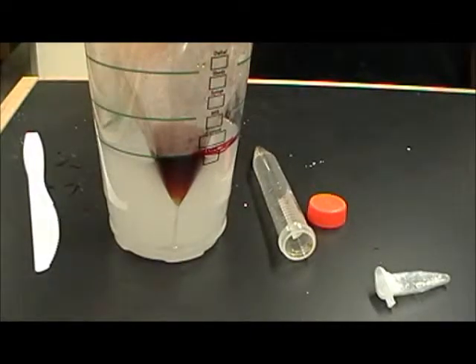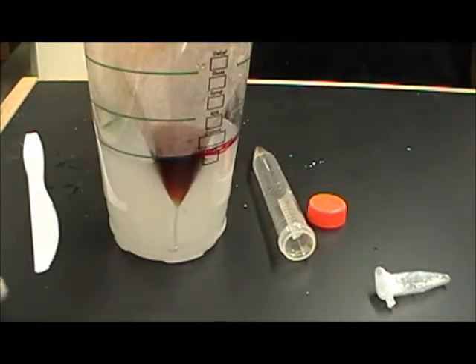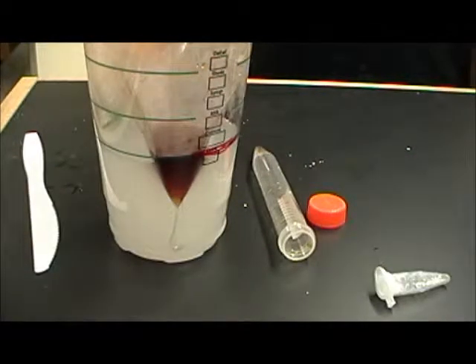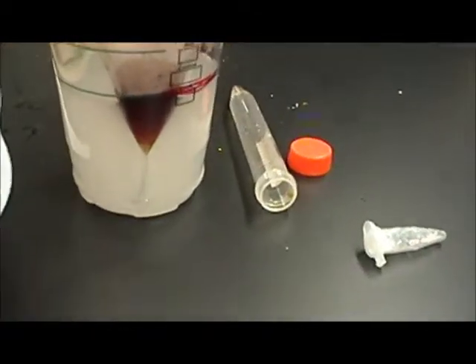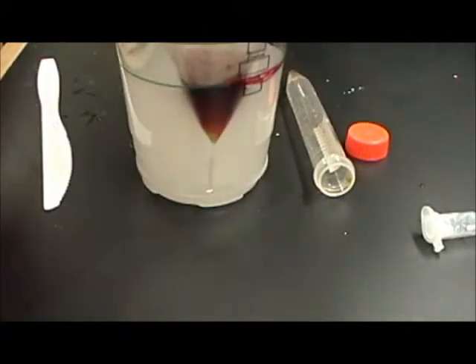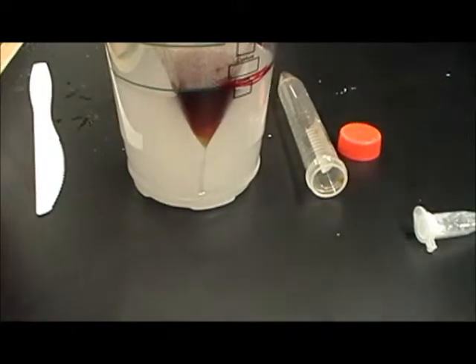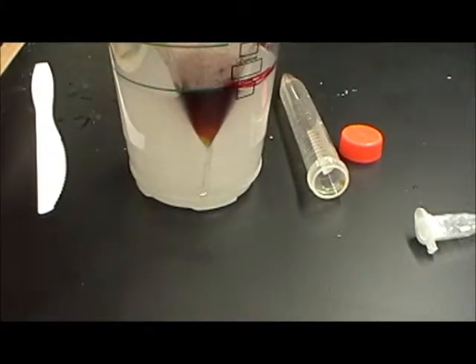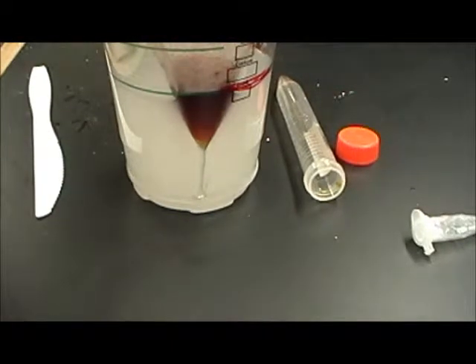So as you can see here, we actually have some of the iodine starting to come out of the bag. This is at the very beginning of the process, and it's just turning these starch particles that it's touching purple right here, not the whole bag quite yet. But this is how it'll start. And when this sort of thing starts to happen, you can have the students tap their cup or shake it a little bit to try to speed up the process. But it'll still take some time for the entire cup of water to turn purple. It is kind of cool to just watch it slowly trickle out and turn that starch purple in the very beginning.